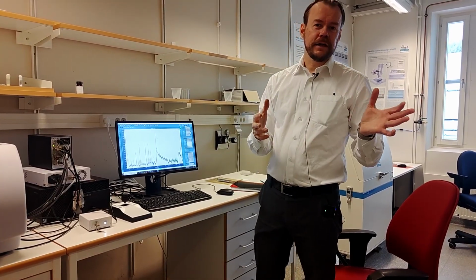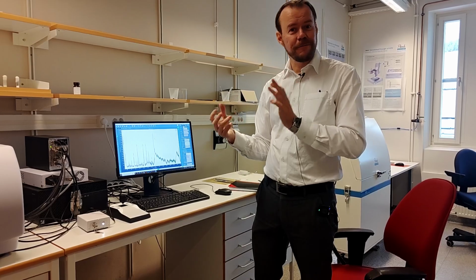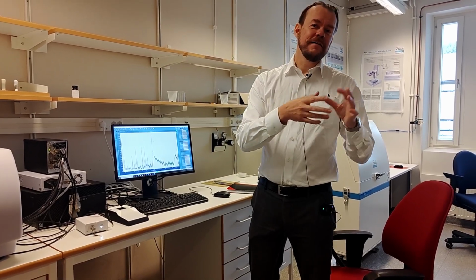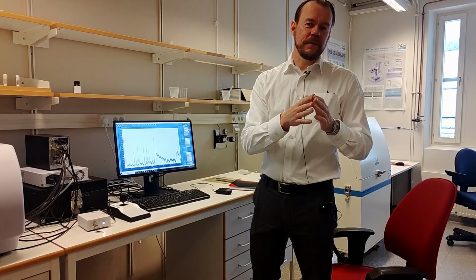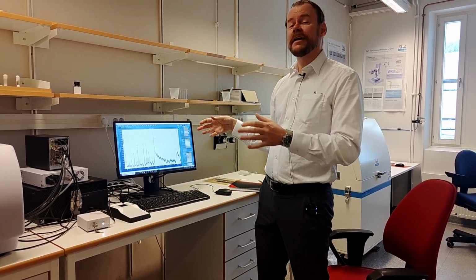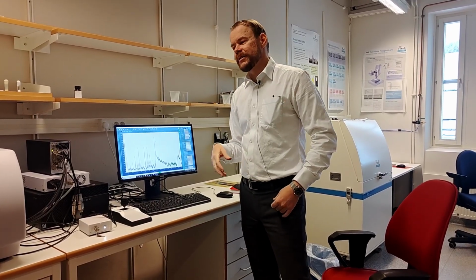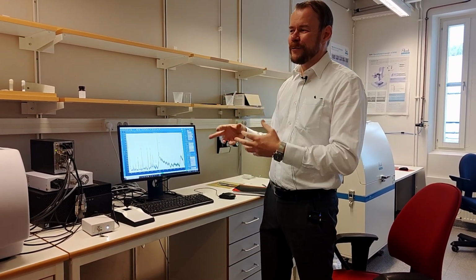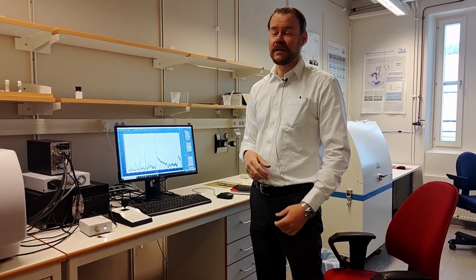So instead of taking 1 spectrum for 60 seconds, we can take 60 spectra for 1 second, right? Or actually, perhaps we want to take 60 spectra, 1 second each, but with a 1 second pause between each also. That can suppress the fluorescence, but usually fluorescence can be very brutal on you, and it's very tricky to get a good signal from that.